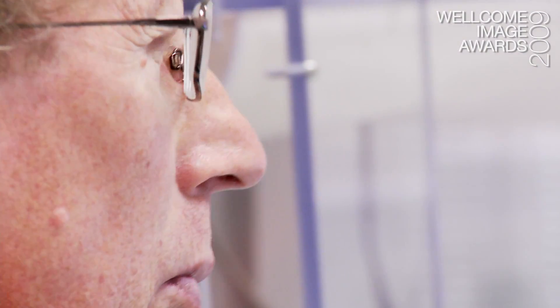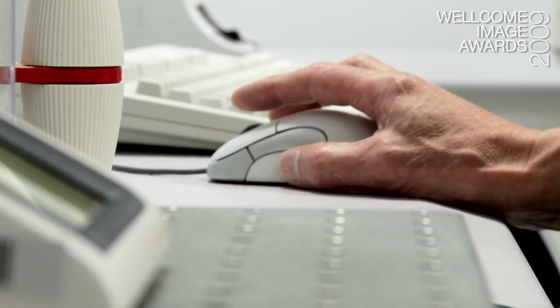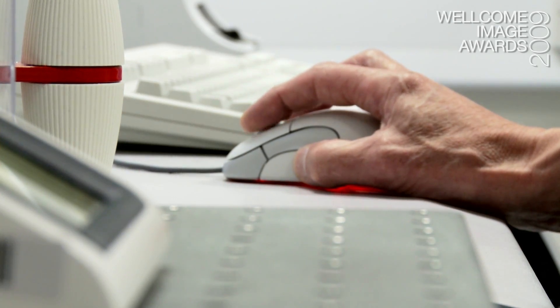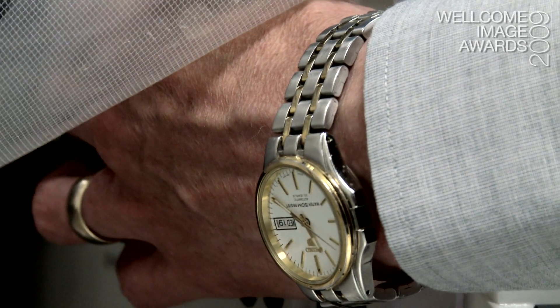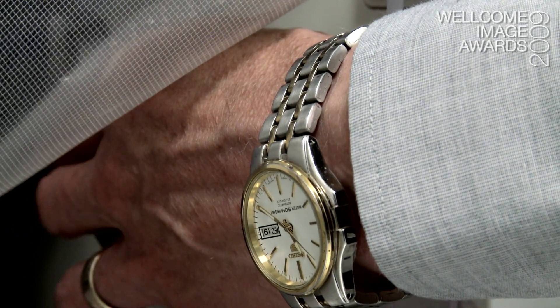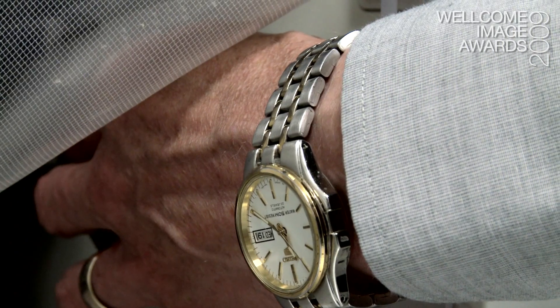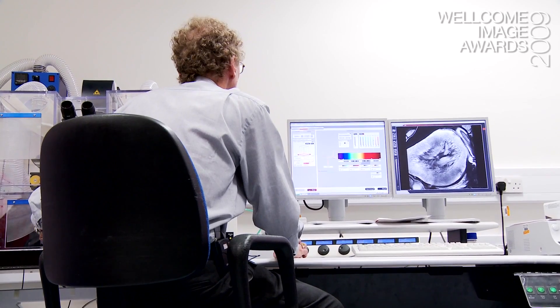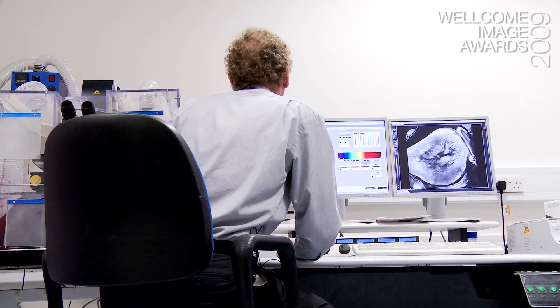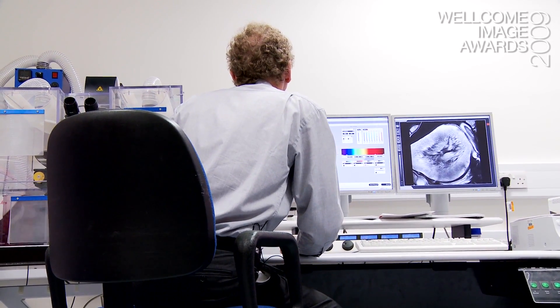You can't say what makes a perfect confocal image because it depends what tissue you're looking at. You're looking to be able to see structures within the cell, you're looking for things that you recognise.